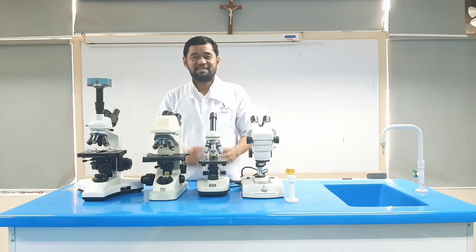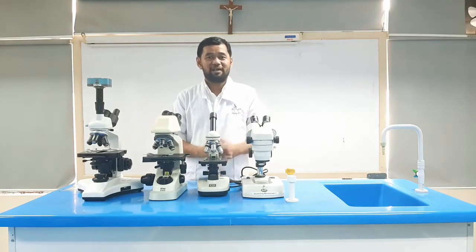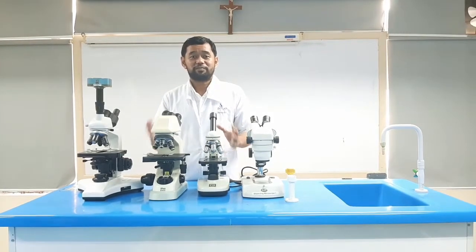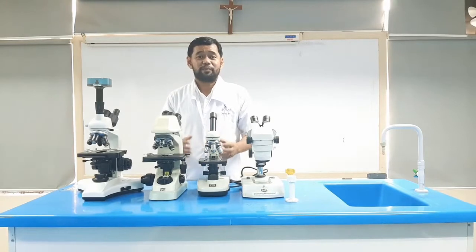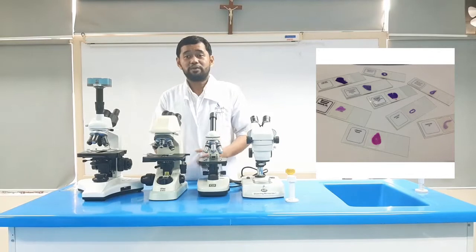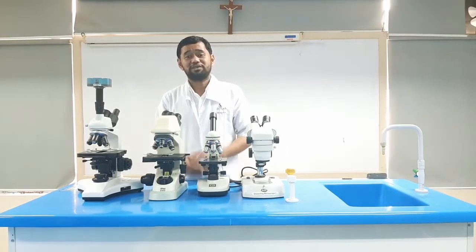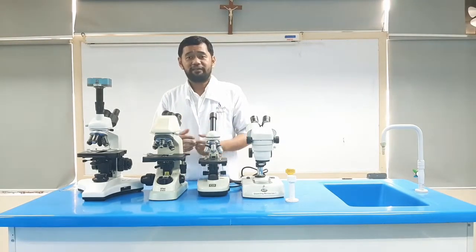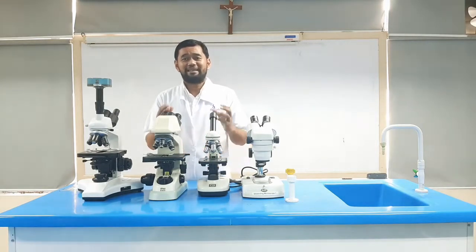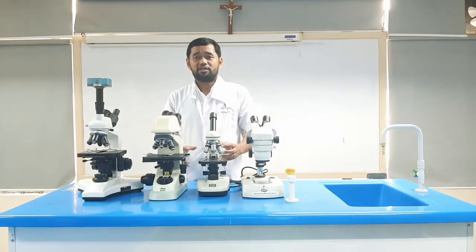more. It is designed for observation with low magnification, while the other three are generally used to view very small specimens or objects that you wouldn't normally see with the naked eye, such as prepared slides of microorganisms and tissues, and they are used for viewing samples at high magnification, which is achieved by the combined effect of the lenses. So this video presentation will specifically entail the different parts of a compound binocular microscope.